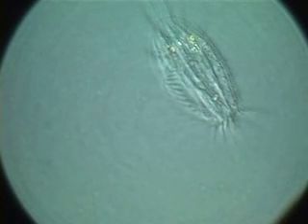This is a different sample — we are looking at about 400 times magnification. This is one of the bigger unicellular organisms we find within sea ice: a ciliate. You can see all the cilia moving at parts of the body. The structure of the cilia — how they are oriented, how many there are, and at which part of the cell you find them — are very important taxonomic clues that help identify these species. Some of these ciliates are probably also endemic to sea ice and may occur only within the ice system.